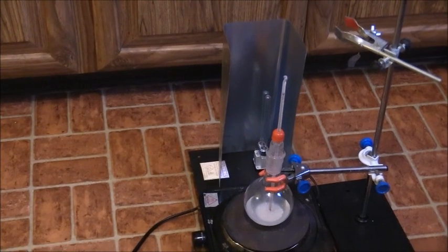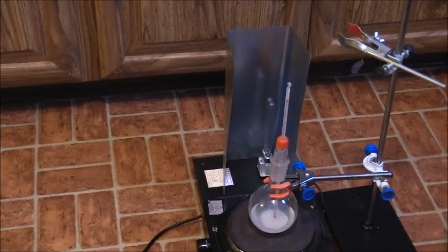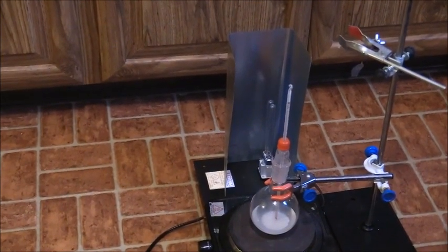Hello everybody, well this is my attempt to create the nucleotide bases from formamide again.